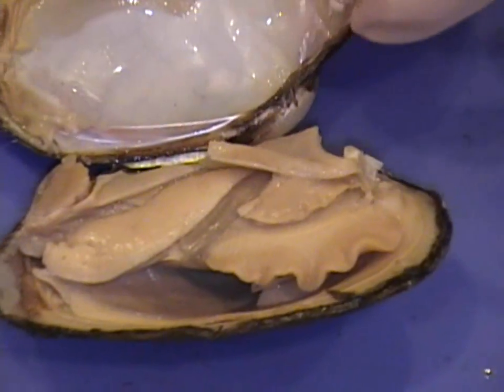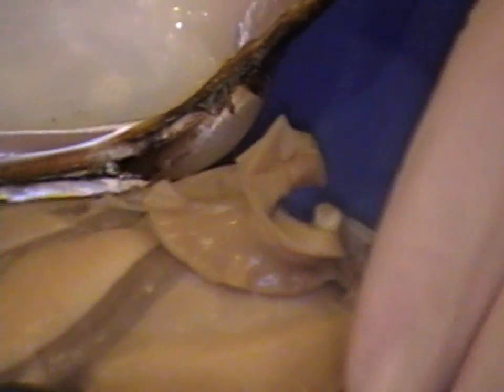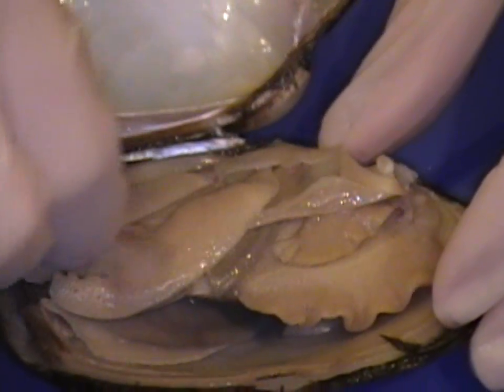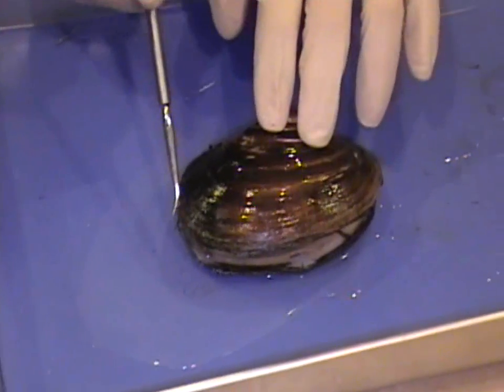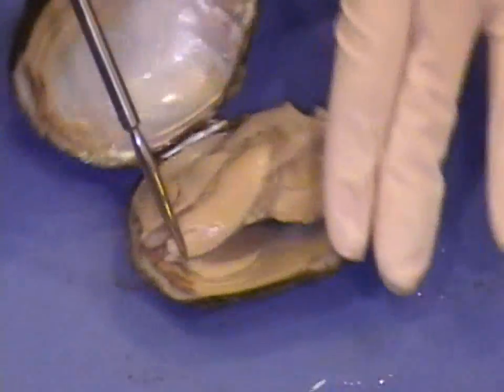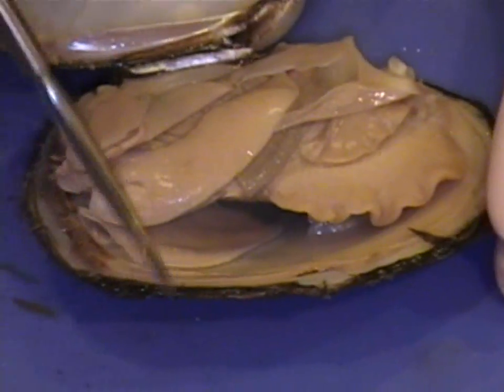Now we're going to peel back. Using a scissor, we're going to cut away some of the mantle that's still stuck to the inner surface, so we can see more of the internal features. We have the posterior and the anterior. Here we have the posterior adductor muscle, and right there we have the anterior adductor muscle. The foot and mantle are on both sides, on both valves.